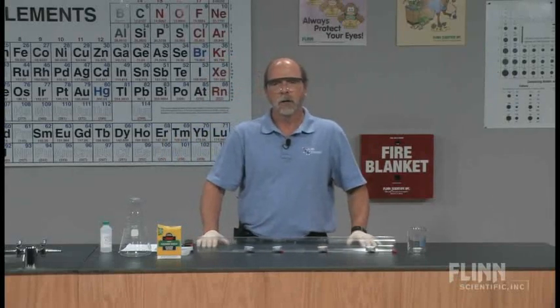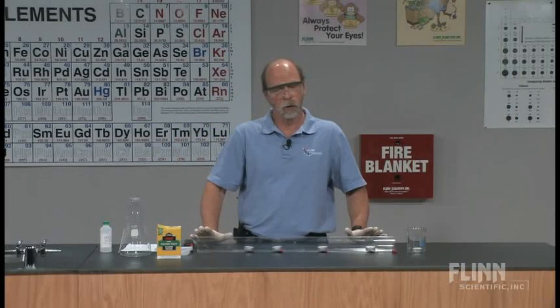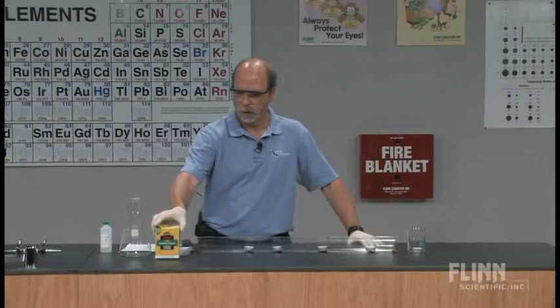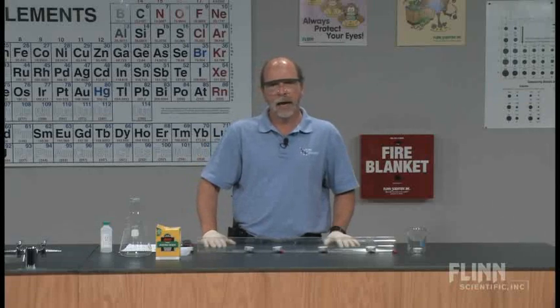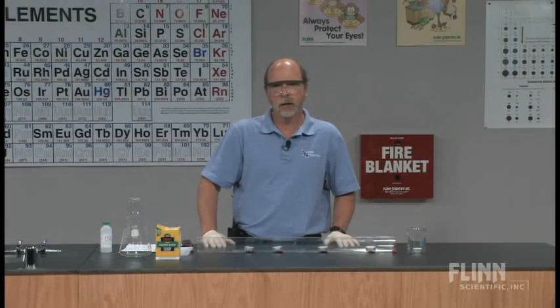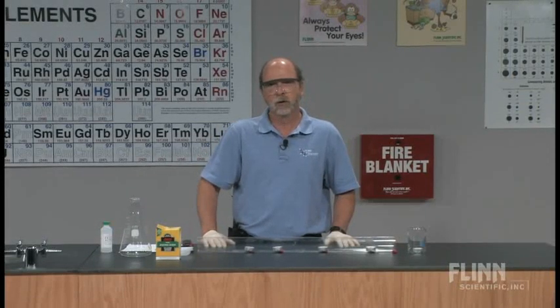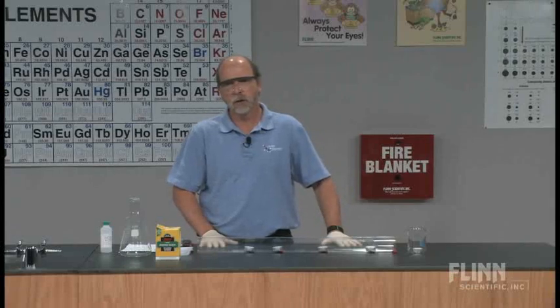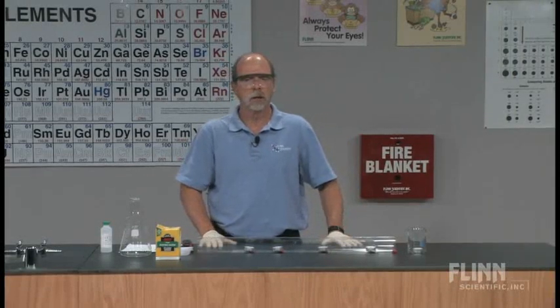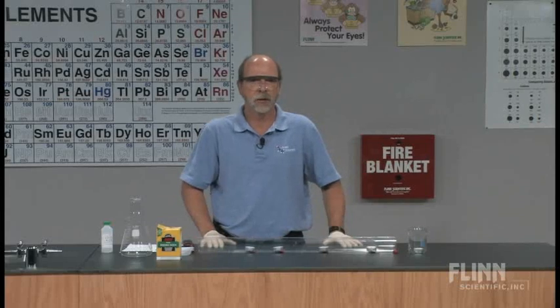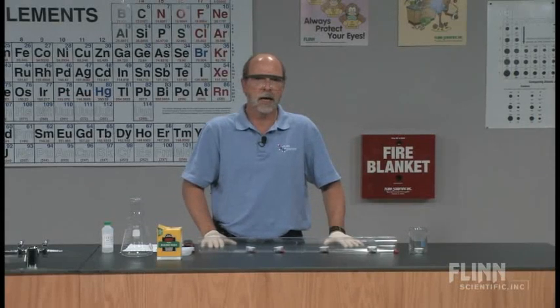I'm going to react some sodium hydrogen carbonate, also known as baking soda, which I've already measured out prior to this setup. I'm going to react the sodium hydrogen carbonate with some hydrochloric acid. Now I'm using three molar hydrochloric acid. You can use one molar, you can use acetic acid, one molar acetic acid or vinegar.